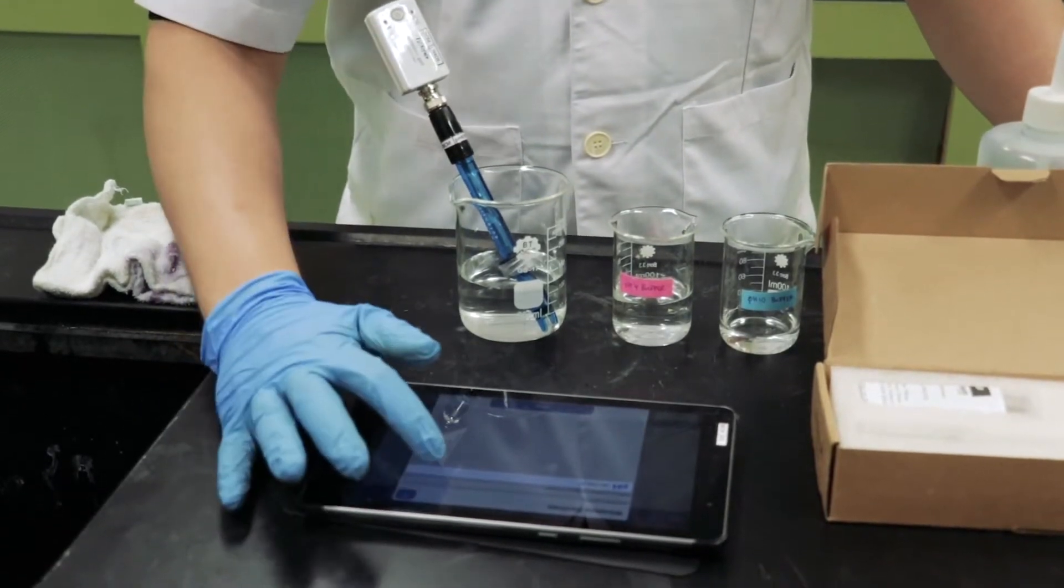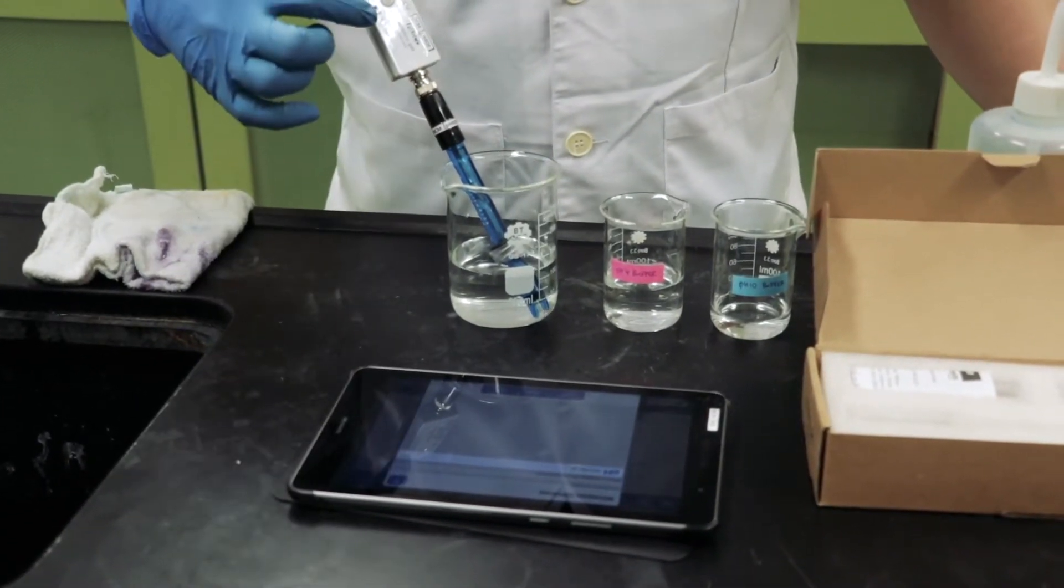Fourth, when the PH Probe is not in use, make sure it is immersed in a beaker of tap water.